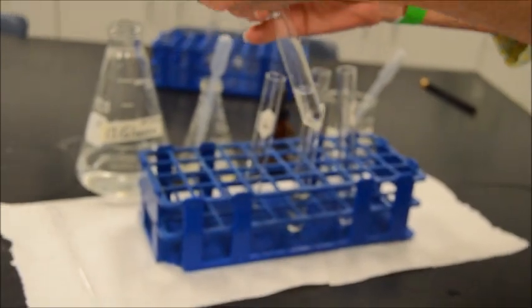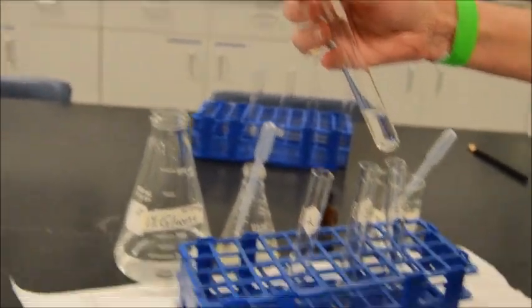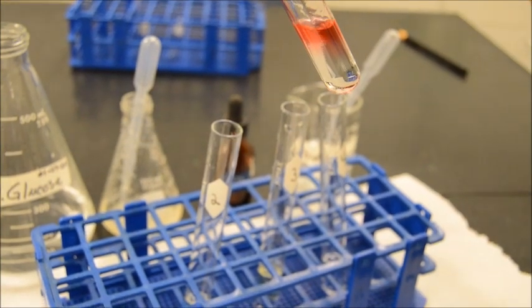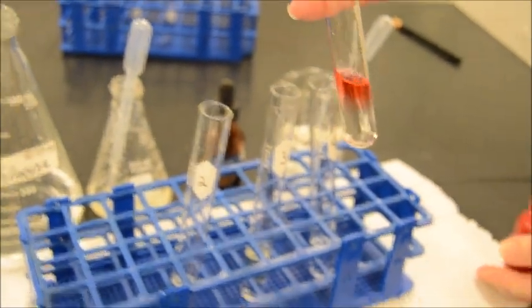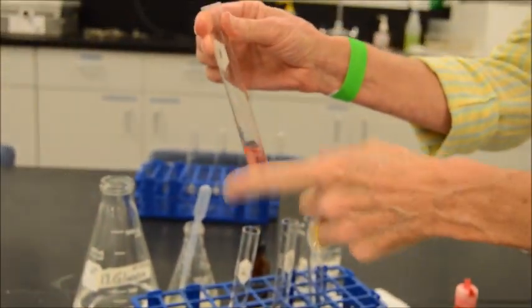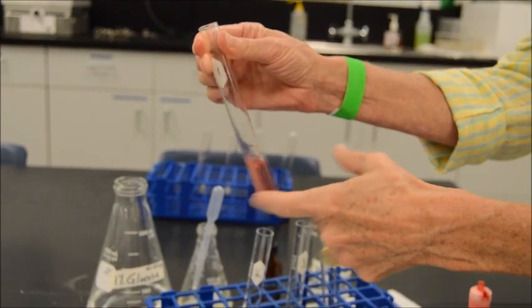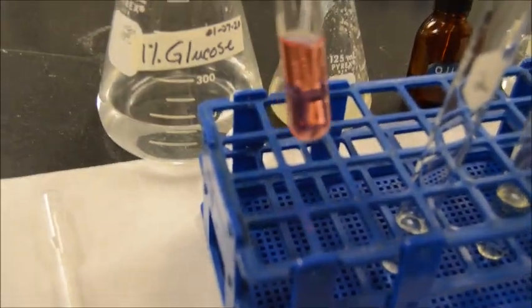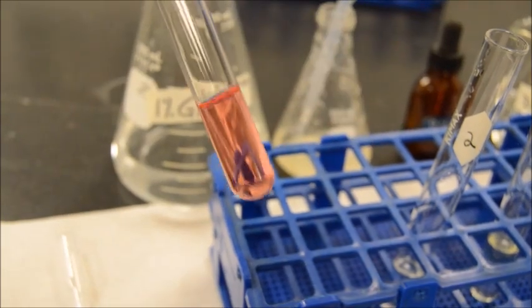So now then, let's add some Sudan 4, and we add drops. So this one is a nice red color to it already. So let's see what happens here. Okay, now with these, you have to really shake, okay? So I've put my thumb over the top, and we're gonna really mix, okay? And what we end up with here is a nice sort of reddish fluid.